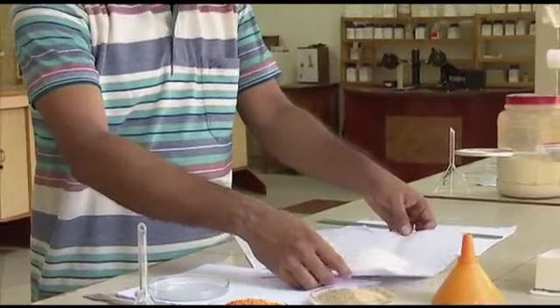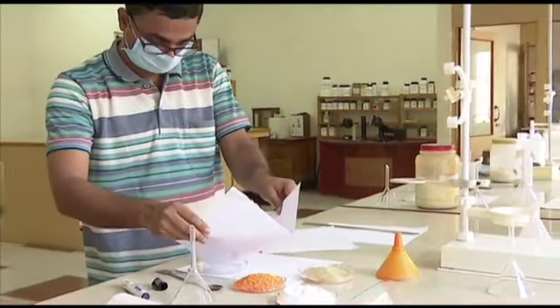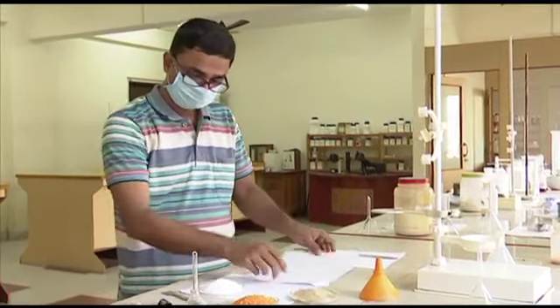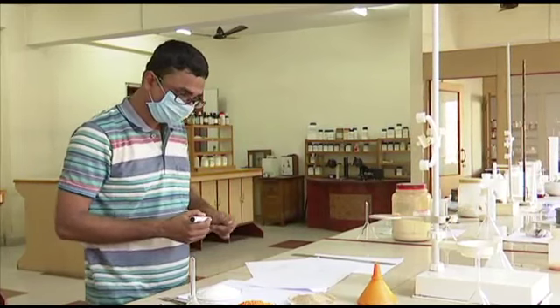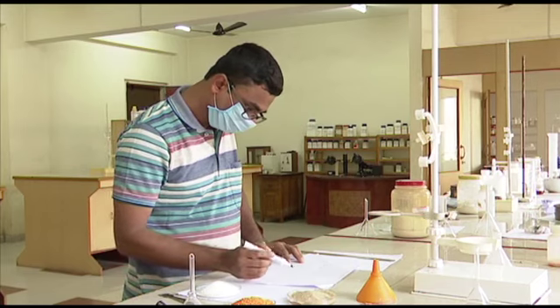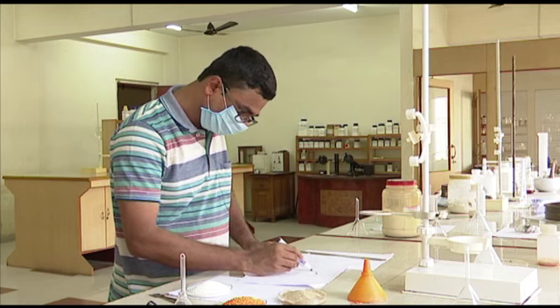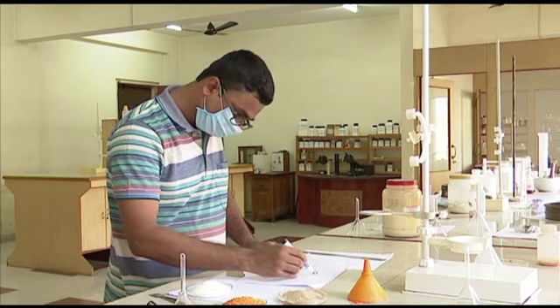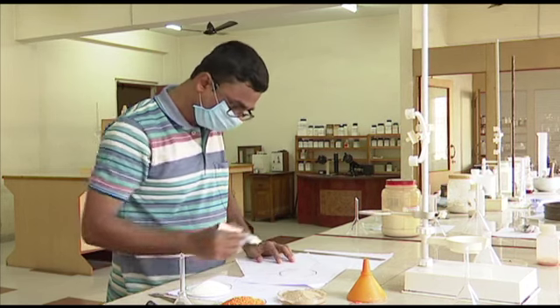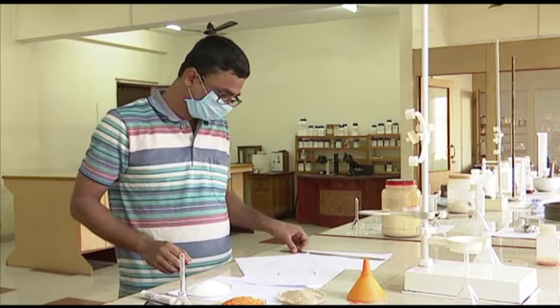So first he will remove the particles from the paper. He is doing it. Number of points had been noted, and that is giving the outline of the circle. Draw the circle. Not a perfect one, but more or less a circle. No, almost a perfect one. Now we have to go to the radius.